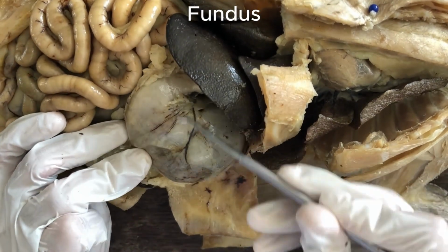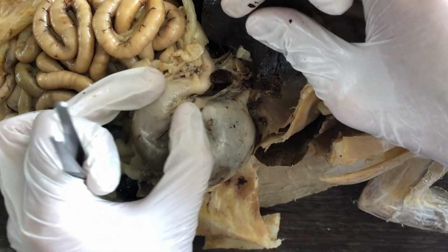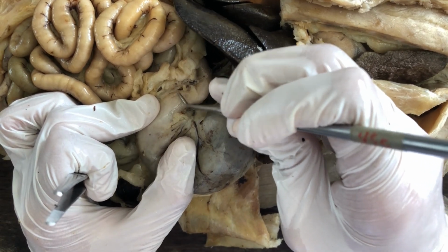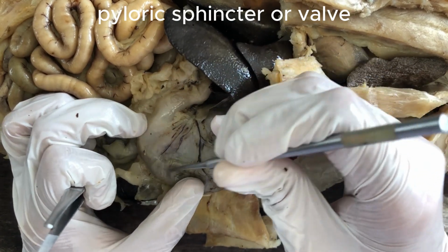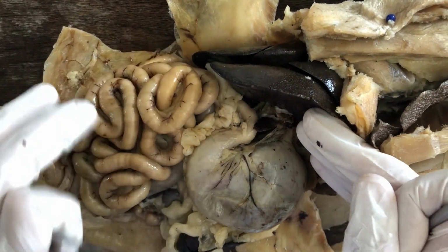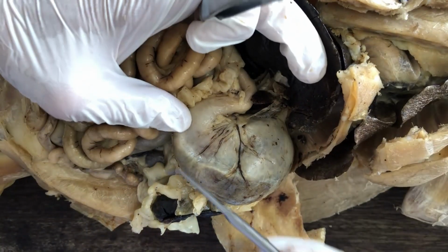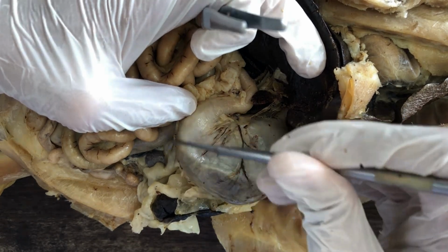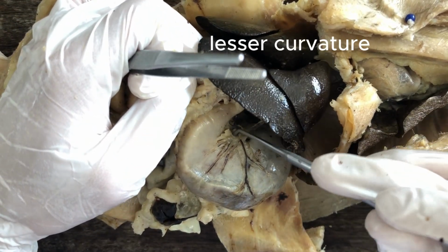And then the largest portion of the stomach is called the body. And the one close to the intestine, it tapers out into a pyloric end, pyloric portion of the stomach. And just like the cardiac end of the stomach, it contains a sphincter or valve called the pyloric valve, which regulates the passage of pre-digested food into the small intestine. So the stomach, its morphology is typically J-shaped or U-shaped. It has a curvature, and therefore there will be a convex border and a concave border. The convex border is called the greater curvature, and then the concave border is the lesser curvature.